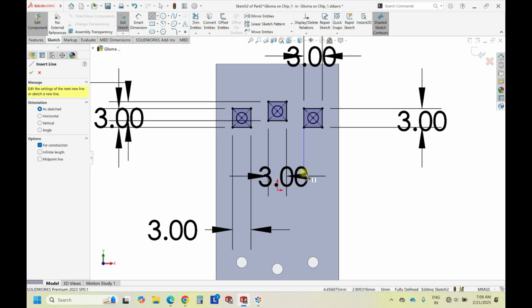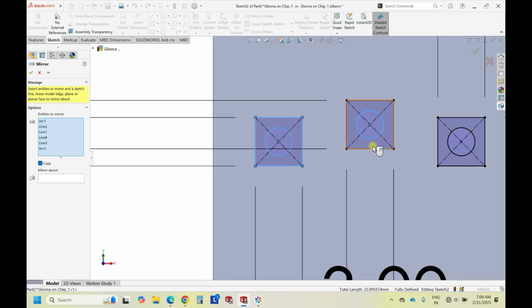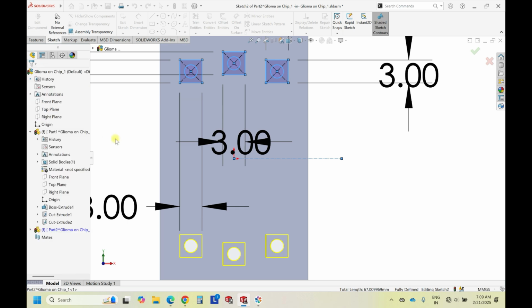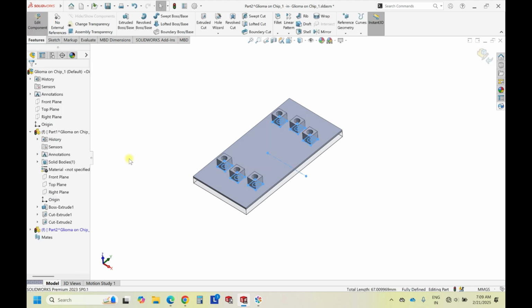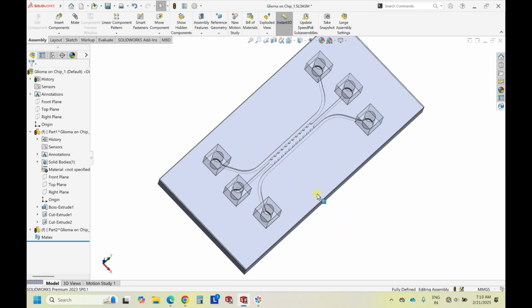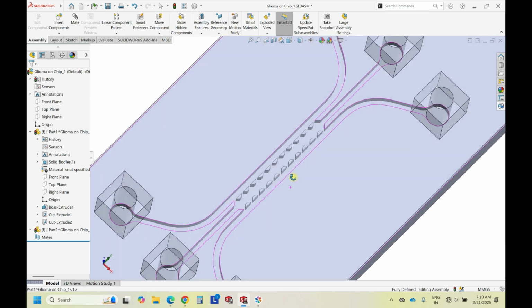Now same way, just draw a center line. Mirror entities. Copy about this line. And I prefer extruding 3 mm again. So this is how the final microfluidic chip looks like. And once you do transparency, you can see the inner view, the internal cell invasive model for glioblastoma cell. So this is a 3D model of that.